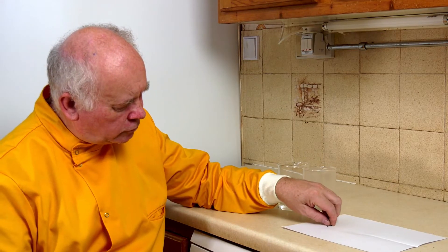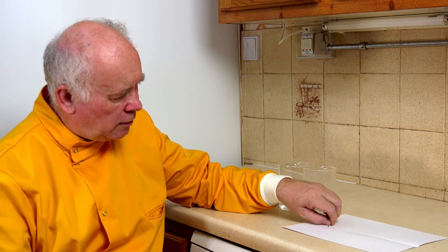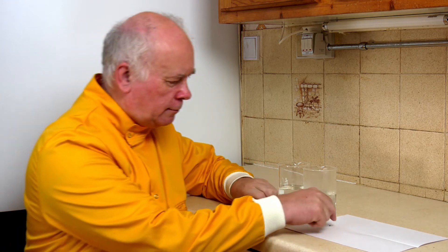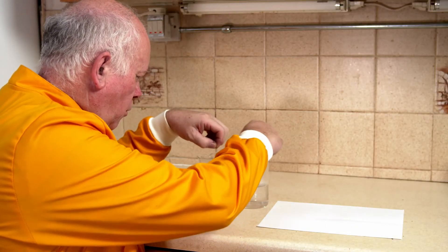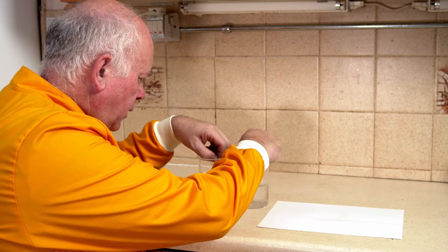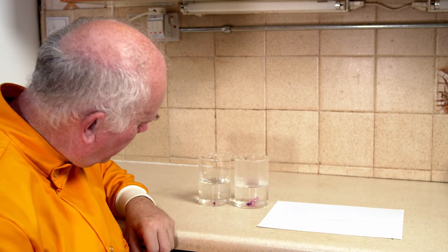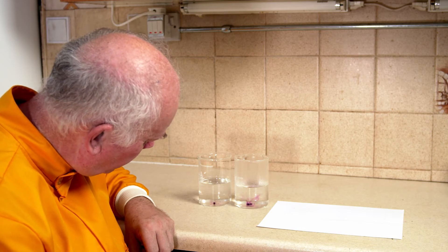And here we've got two crystals of potassium permanganate, a very intense dye. What I'm going to do is drop the two crystals into the water in the centre as best I can, and what we're going to try and see is the difference that happens.